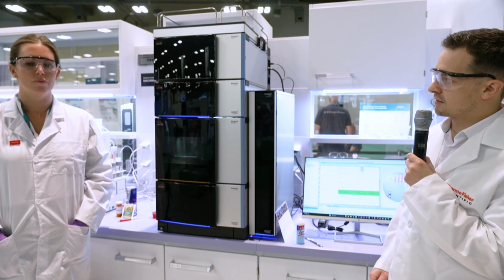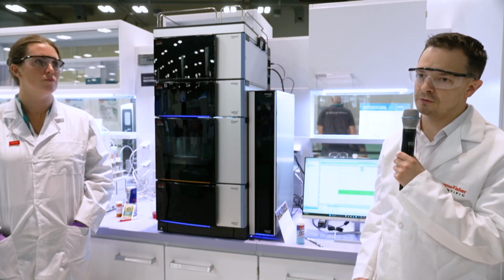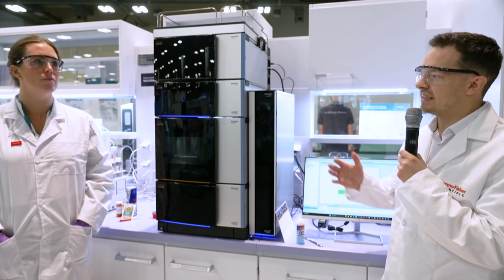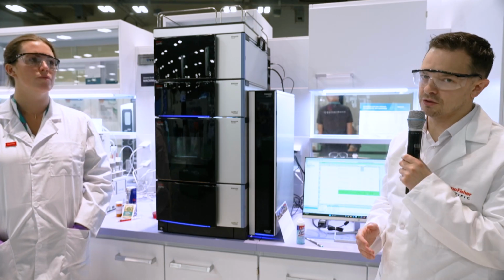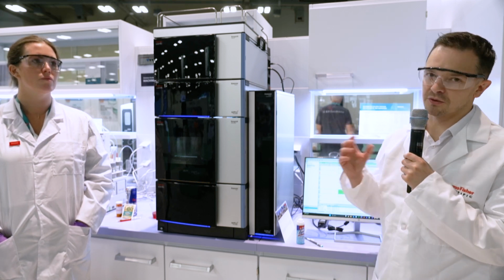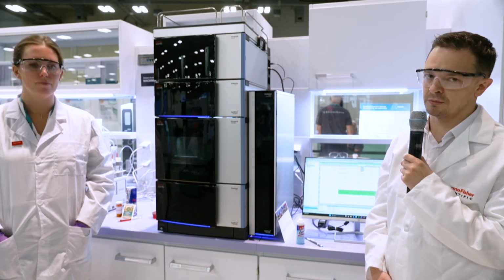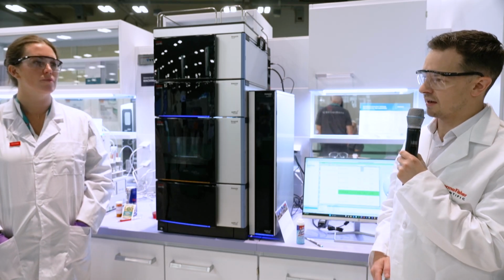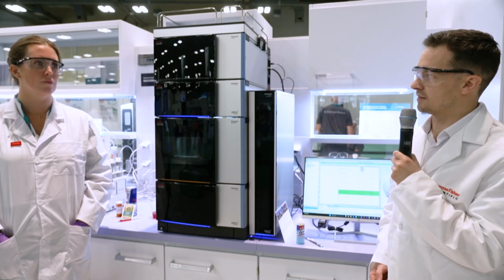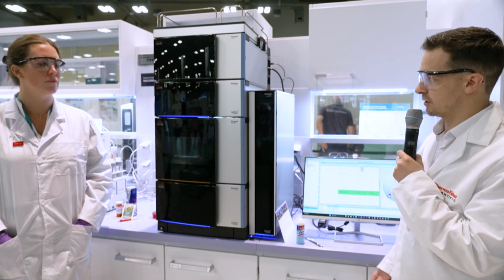Another type of detection is ELSD, and that generates a similar type of aerosol, but that uses light scattering to do the detection. Now, the problem with ELSDs is that you don't really get a uniform response. You get a sigmoidal curve, and that can cause sensitivity issues, and you get a lower dynamic range with that kind of detection as well. So the CAD overcomes that. You get a nice response curve that's very predictable, and therefore you get great sensitivity, and you get a higher order of magnitude when doing your analysis as well.